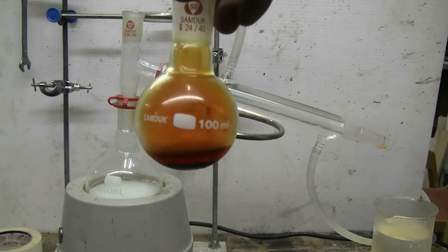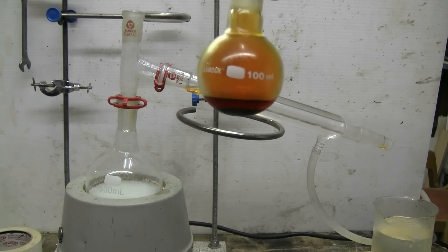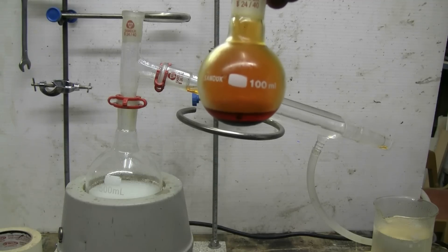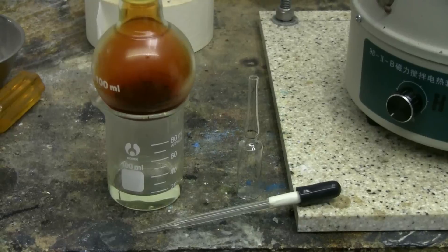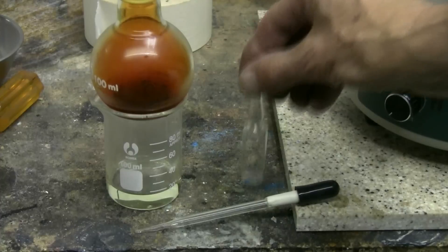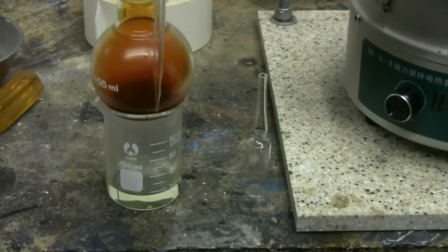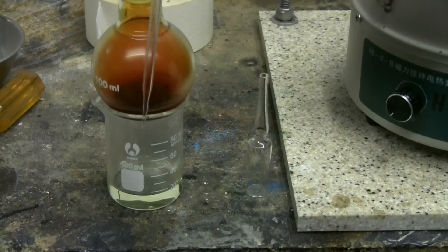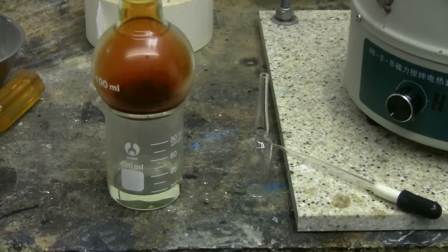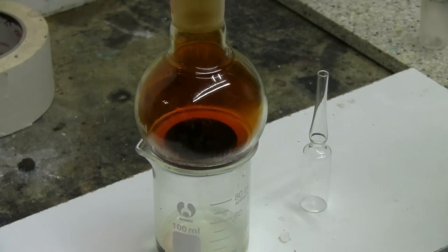Here is a look at the product. We can see in the bottom of this 100 milliliter round bottom flask that there's a layer of bromine water on top of a layer of elemental bromine. I have a pipette eyedropper and an empty glass ampoule to put the bromine in. I'm going to use the pipette to suck up the bottom layer of bromine and put it into the ampoule - so let's set up for this and get started.